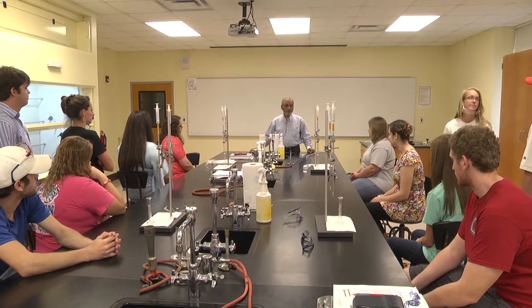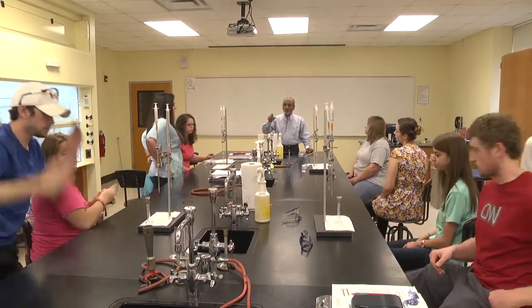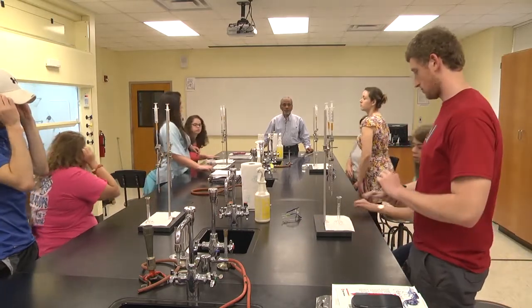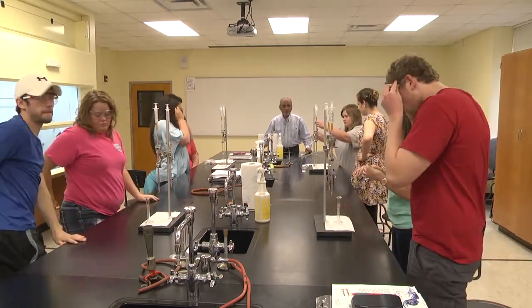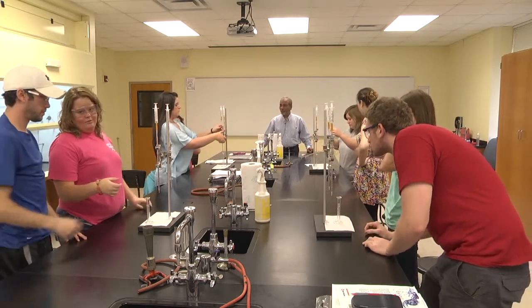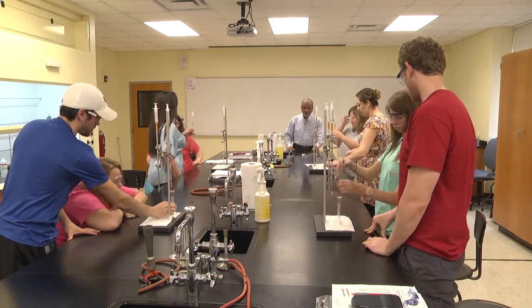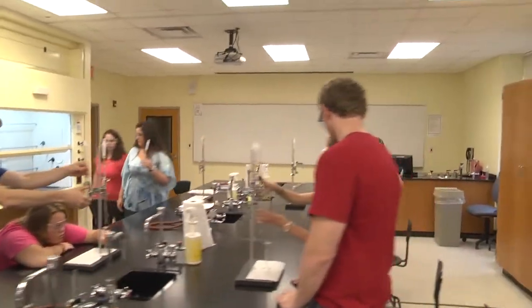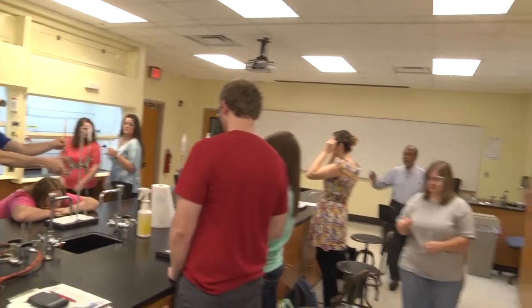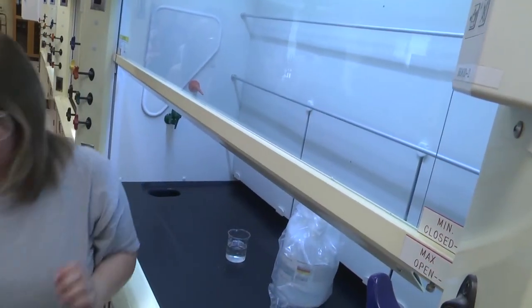Okay. So let's go ahead and start the experiment. All right. And you use the two burettes. In one burette you will take the sodium hydroxide, and in another burette you will take vinegar, and use the phenolphthalein as the indicator. Okay. All right. Let's go ahead and start. Make sure everybody has safety goggles. Okay, very good.